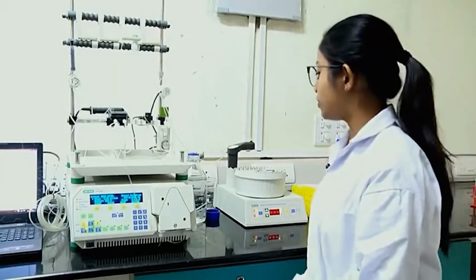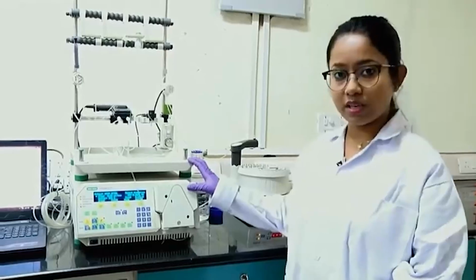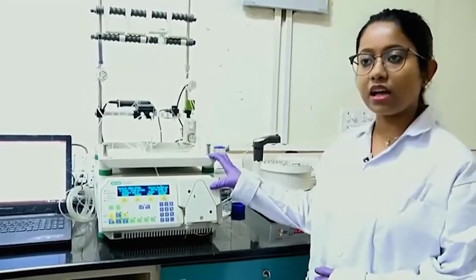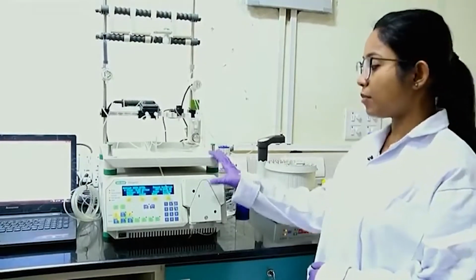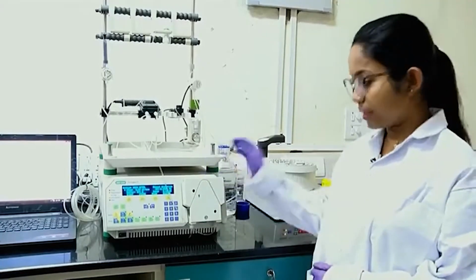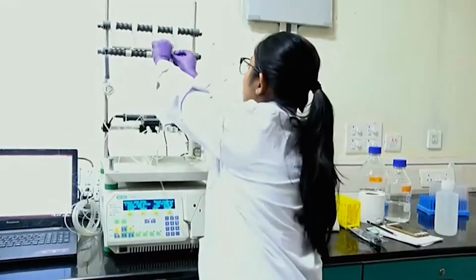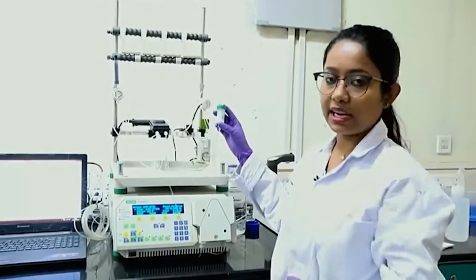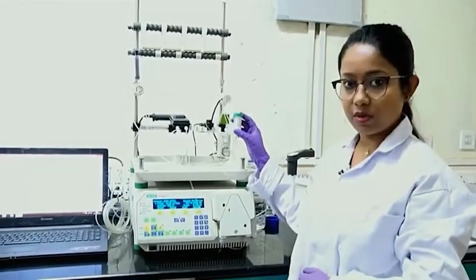So, now what we have here is an FPLC system. This is a semi automatic FPLC system where, based on the pressure, it will take some amount of buffer at a particular flow rate and pass the buffer through a column which has the nickel beads in it. So, this is the column which we have. This is a 5 ml column volume NiNTA column, also known as an IMAC or affinity chromatography column.